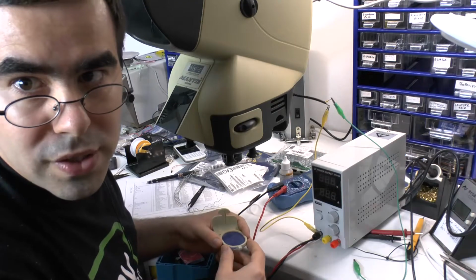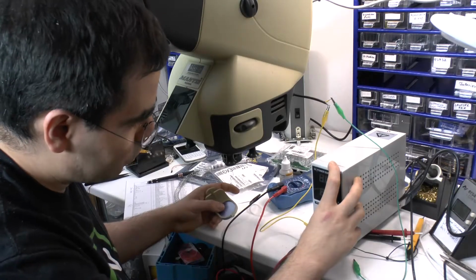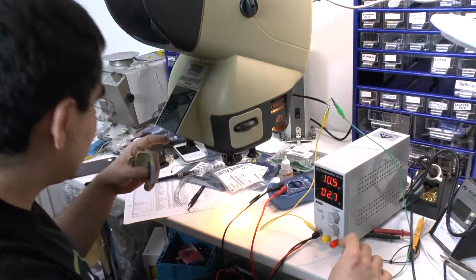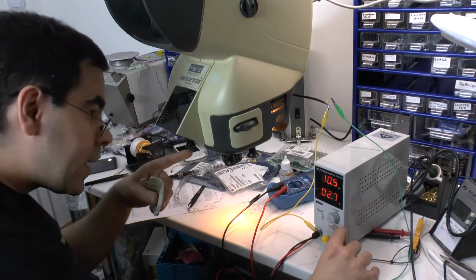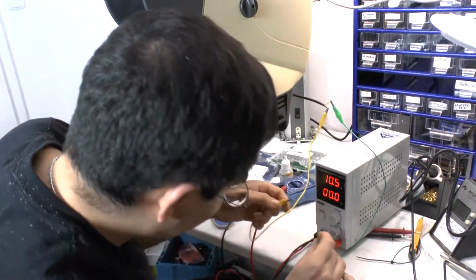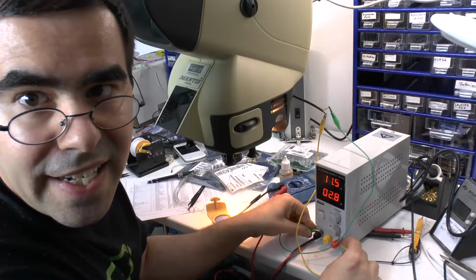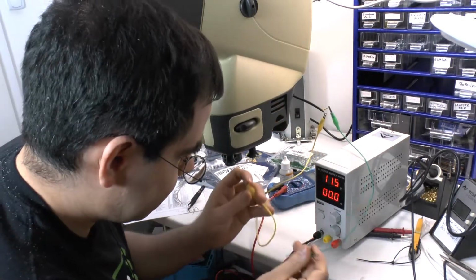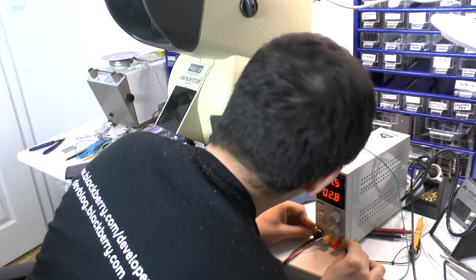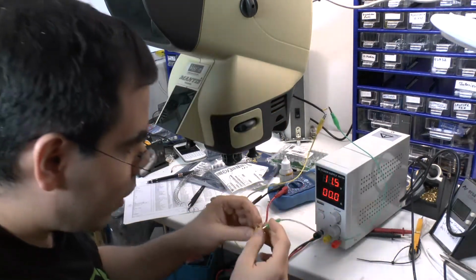On the long run, of course, I'm going to replace these halogen bulbs because they get hot as hell. So, let's try it once again. Amusingly, the cooling fan doesn't turn. So let's try one other act. Let's try changing the polarity. Now I hear a little bit. So let's try something else. Nope, the fan still doesn't spin up. So let's try the other way around again.